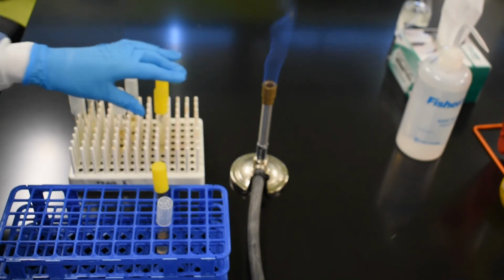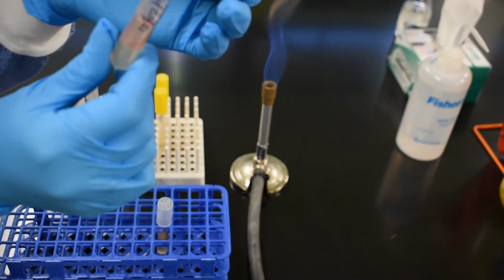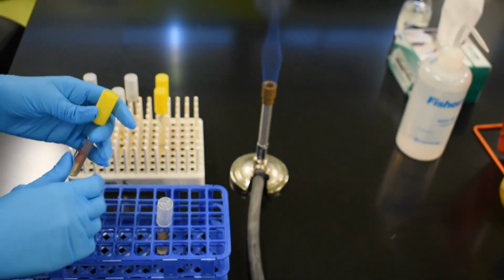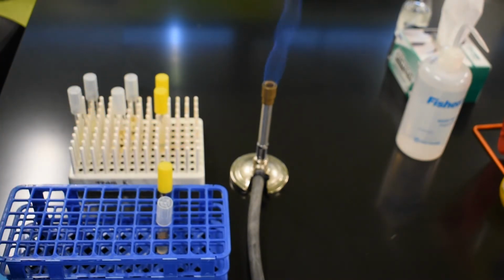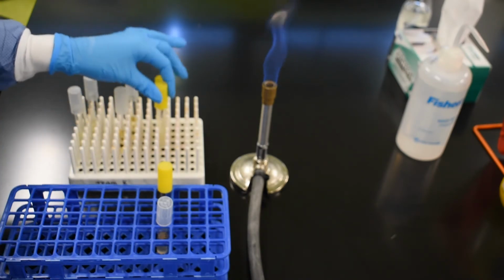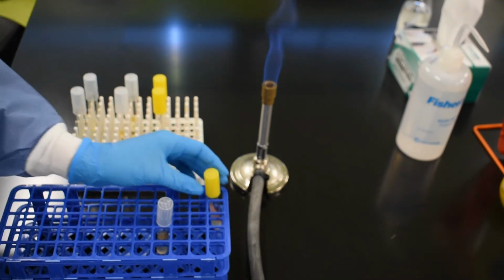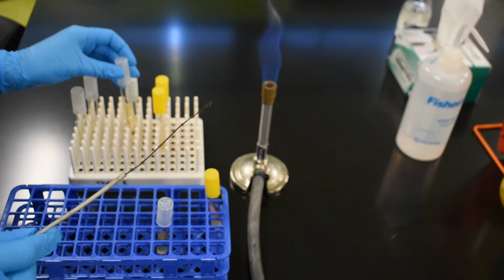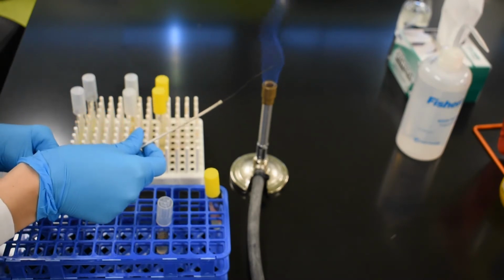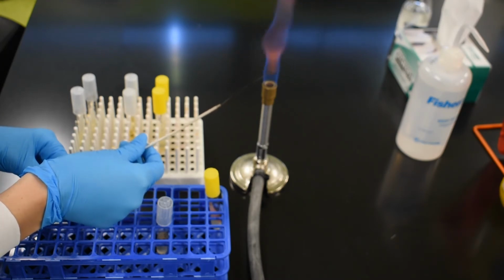So let's get started. I am going to begin with our Serratia marcescens slant stock. And before we begin, we want to make sure that we sterilize the instrument that we're using for the inoculation. My first inoculation is going to be Serratia marcescens from the slant to a broth. Because it's a broth tube, I want to use the loop. So I'm going to take the loop and I'm going to heat it in the flame of the Bunsen burner until it gets red hot.